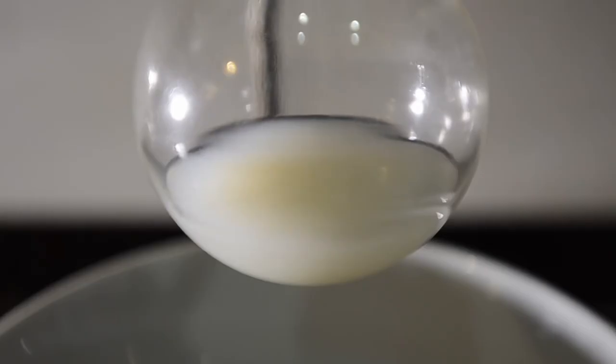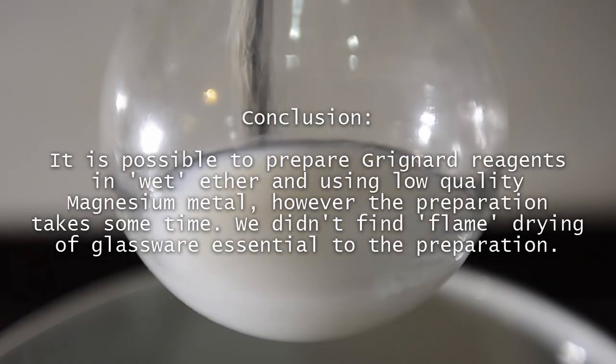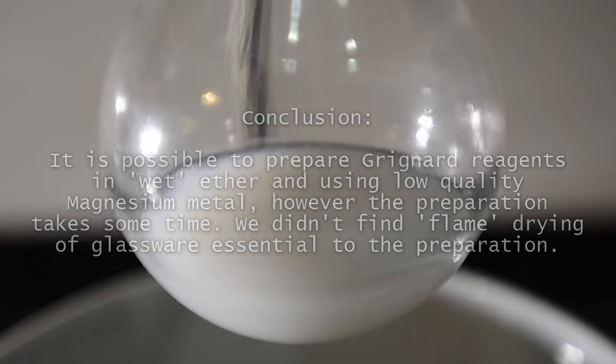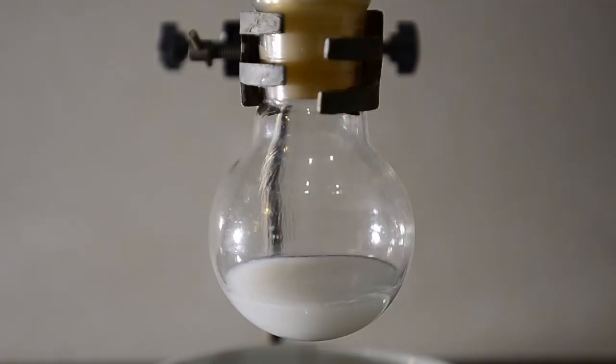Our conclusion is that the reaction needs to be dry, but past a certain point the quality of the magnesium you use has a greater impact on the reaction speed. But you can get away with quite a lot.